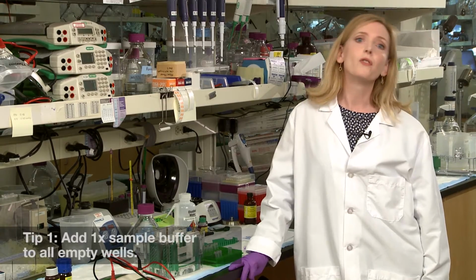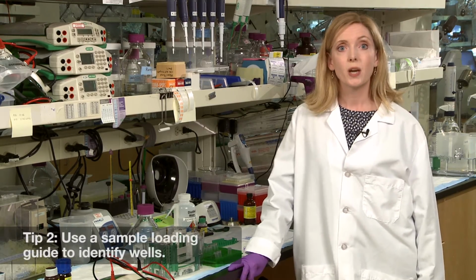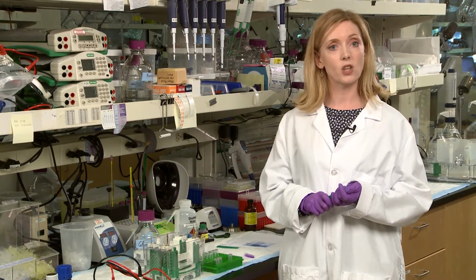Tip one, to avoid edge effects, add a 1x sample buffer to all unused wells and never overfill a well. Tip two, to identify wells, use a sample loading guide or mark the bottom of each well with an ethanol soluble marker before removing the gel comb.